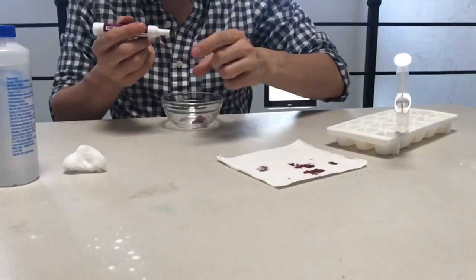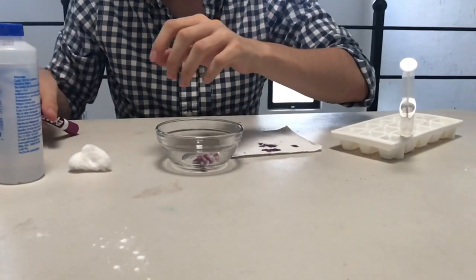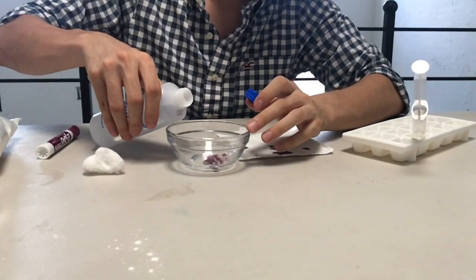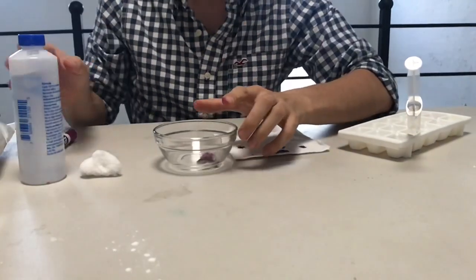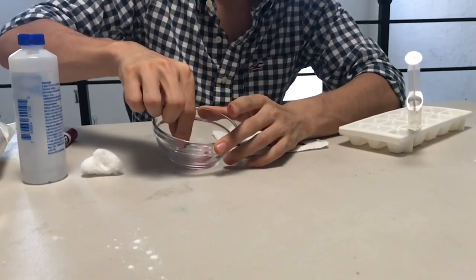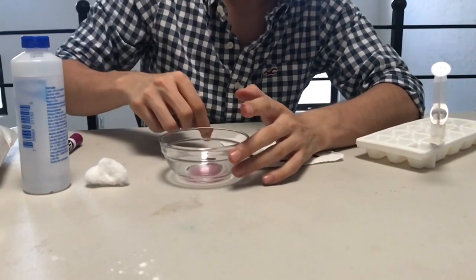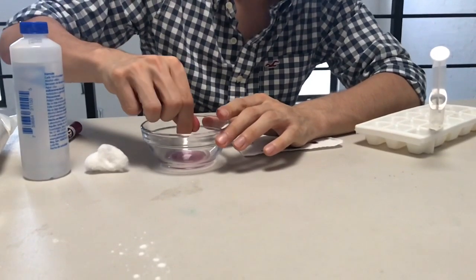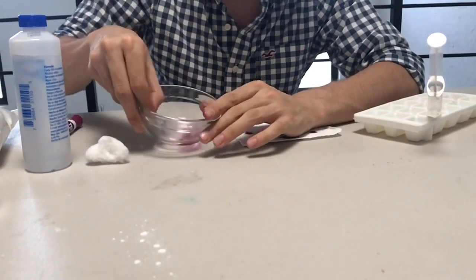And then in a bowl like this we will put them in, with a little bit of ethanol like this, and stretch the cottons to make the color go out. Try to make a saturated solution of color the best that you can, and then we have the color.